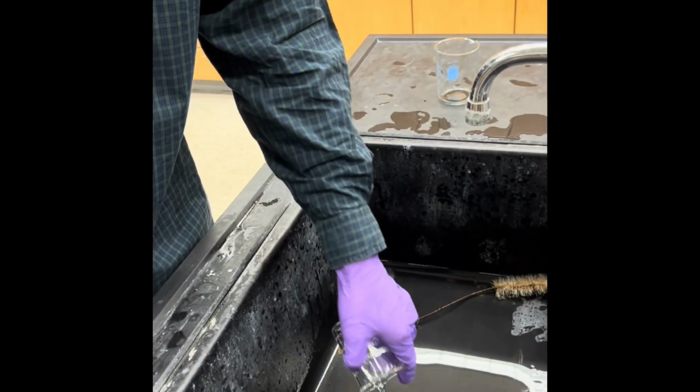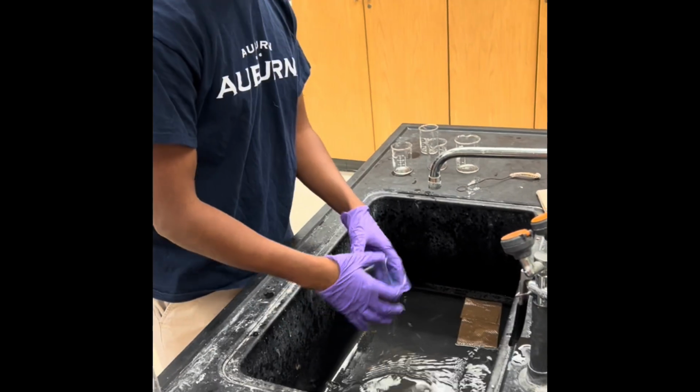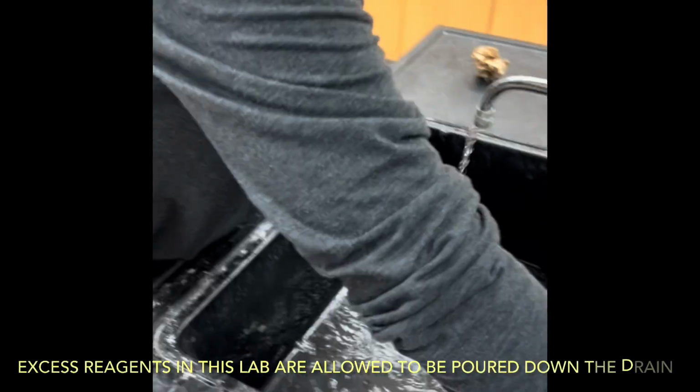Once the lab is complete, all members must participate in cleaning up the workspace. All materials and trash must be put in the correct area. Excess reagents are put down the drain.